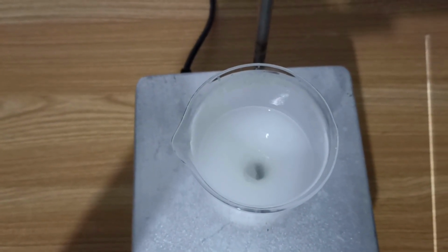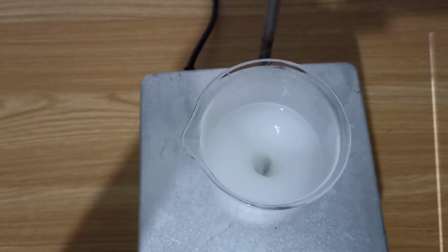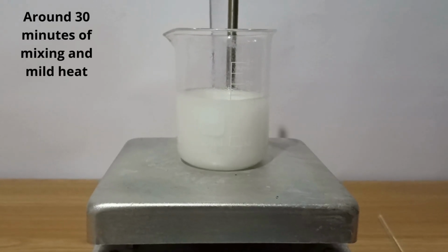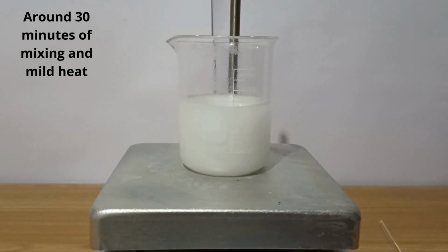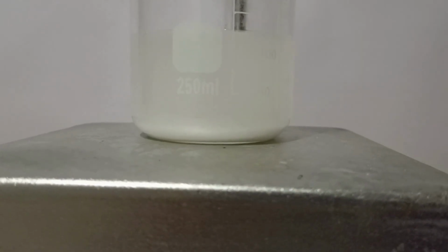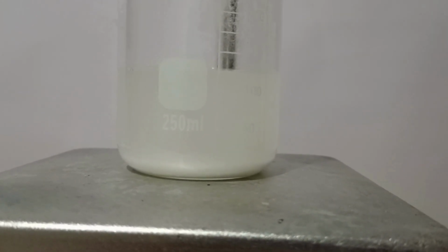The acetaminophen completely dissolved, and the excipients remained undissolved. I let the solution cool, and as you can see, the excipients precipitate.